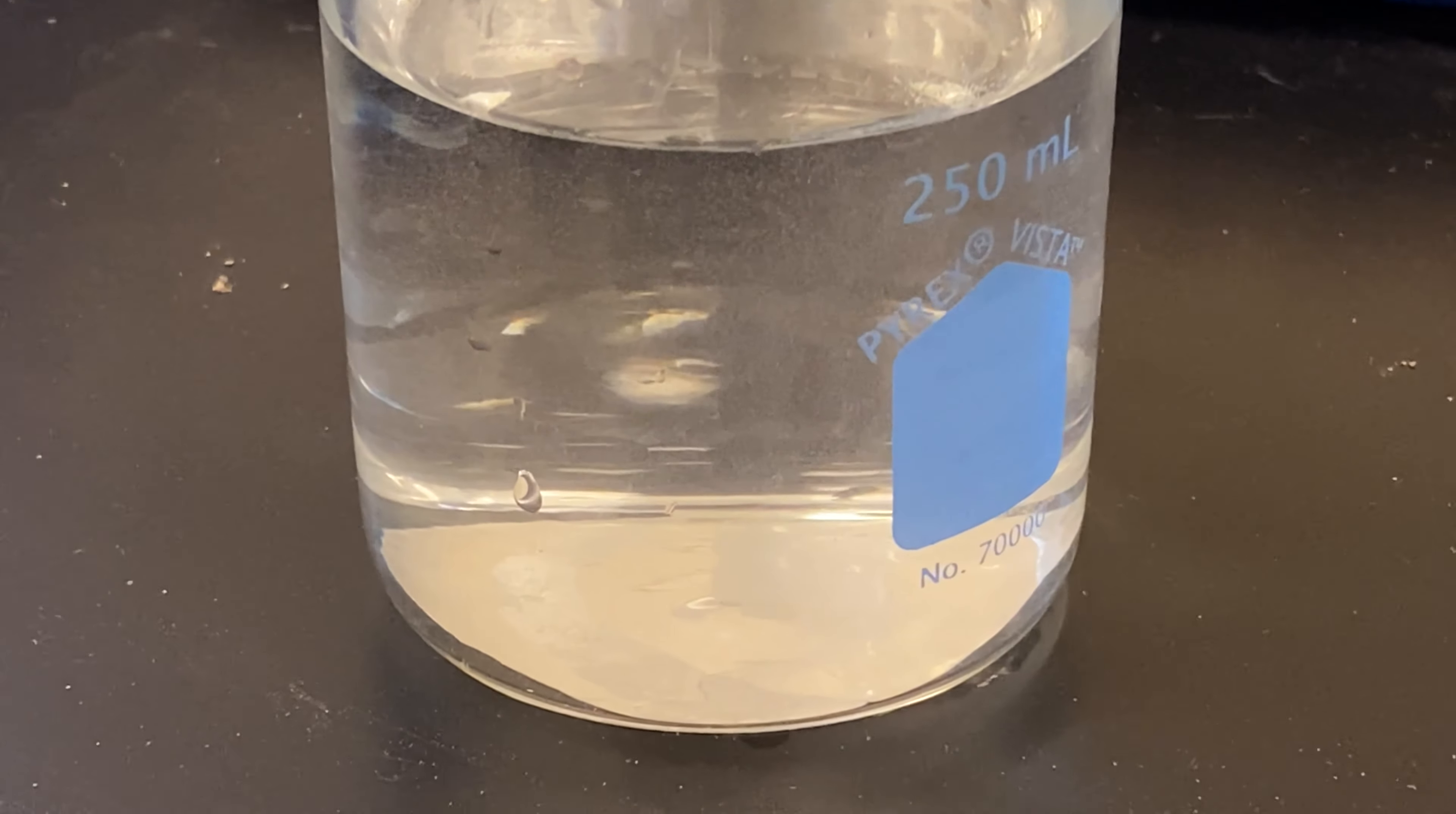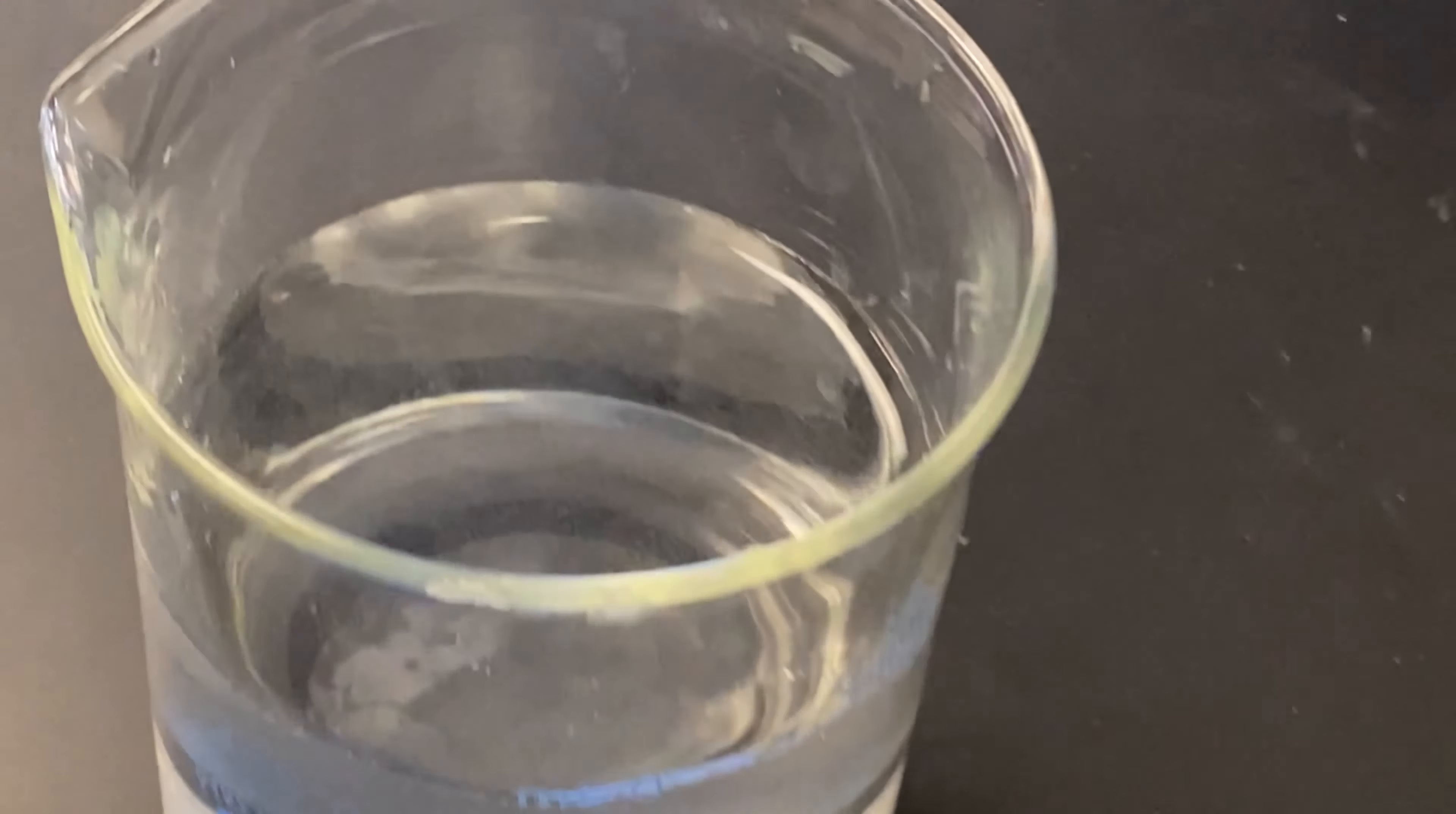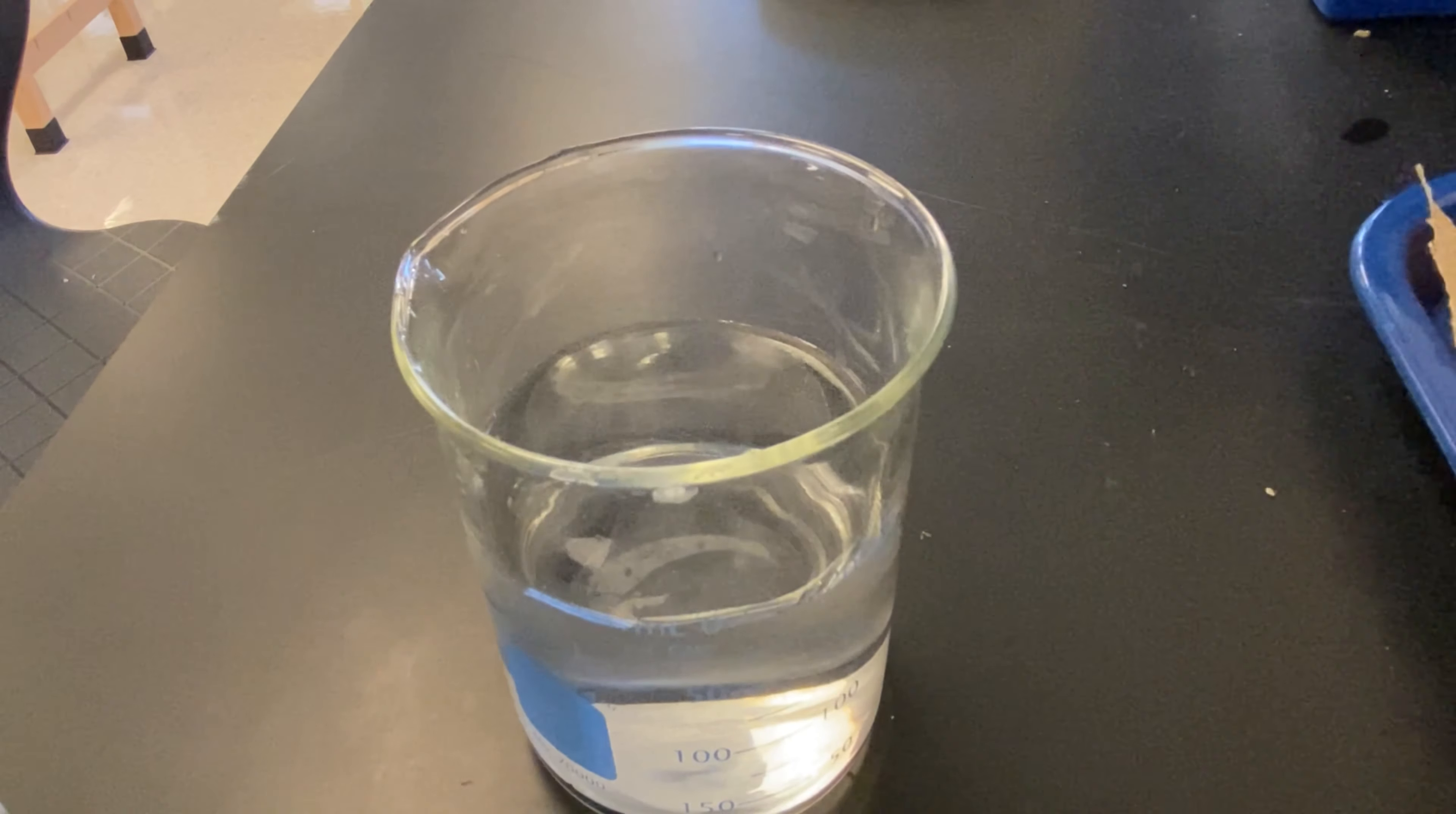And then it's gone. But take a close look at the water. We have some sort of powder starting to form in the water. You see it in there? We also had kind of a white smoke. Now, I don't want to breathe that smoke in. In fact, you can't see, but I have some windows open nearby, and I have a mask on to kind of help keep ventilated here. Let's try that again.